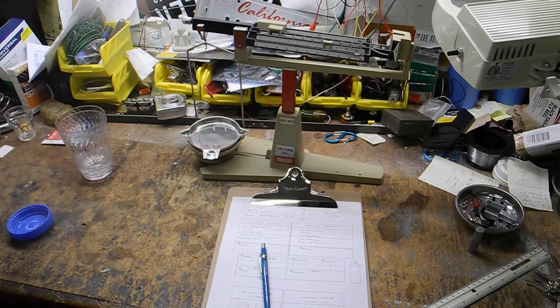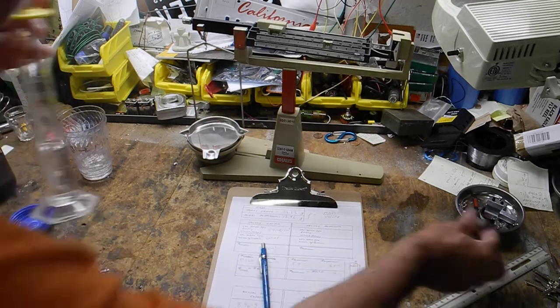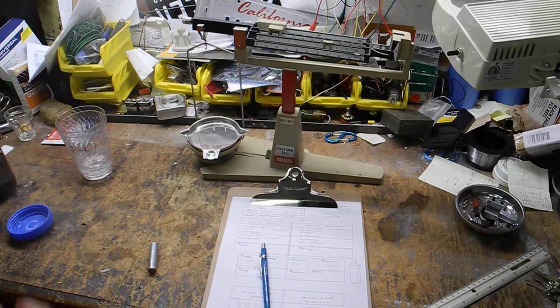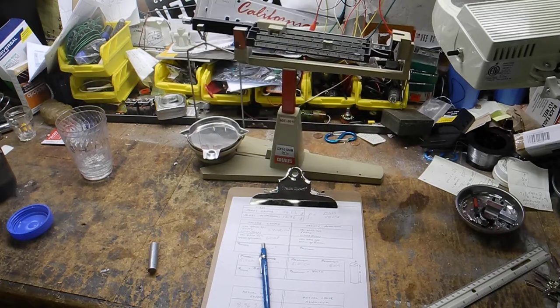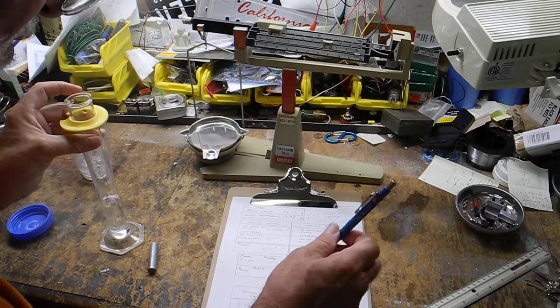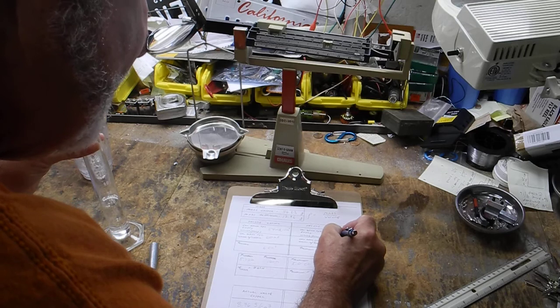Okay. So I'll pour water in there. Okay, that's enough, I think. Let's see. Yep, that's enough to submerge it. Okay, and our level is, you can see it's between 30 and 40. Let me get a good look at it. So let's see, 35. That's 36. Okay, so empty, it's 36 milliliters.